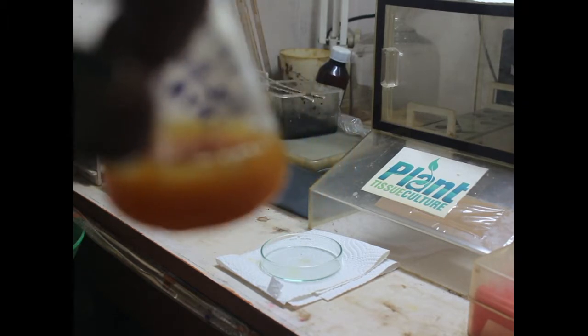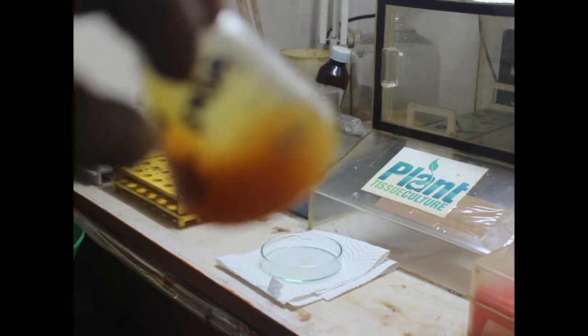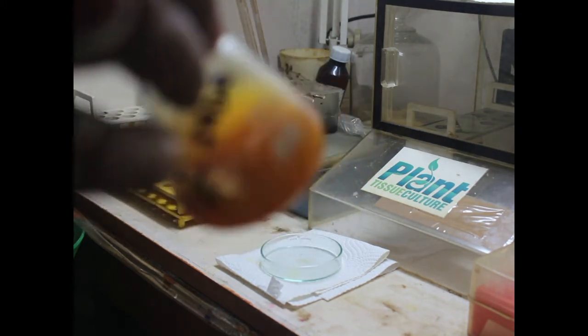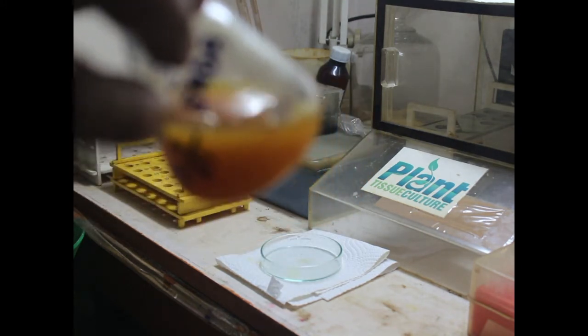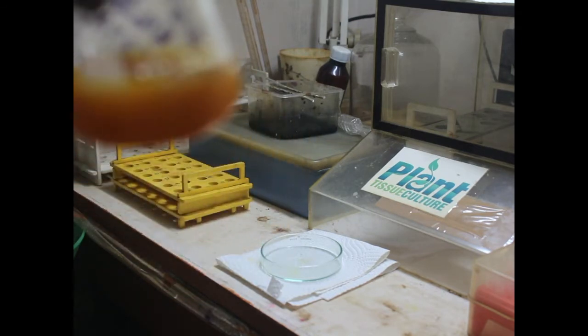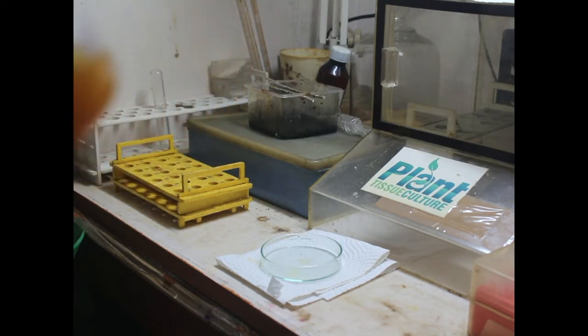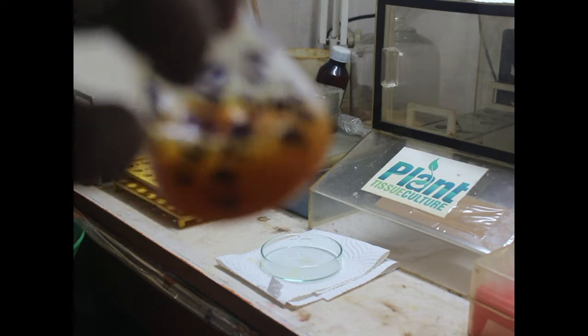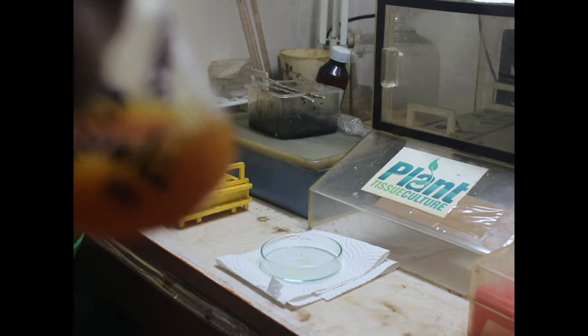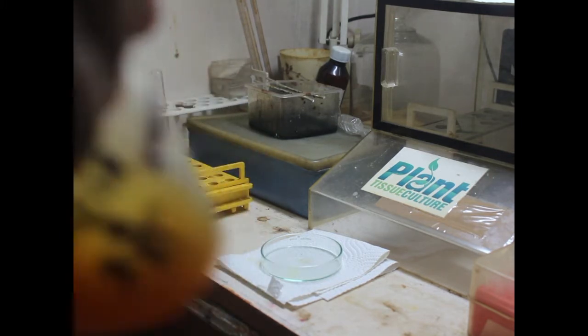This fungus has been started in culture from 3rd September 2021, and today in the morning a formation of mold was found. From this mold formation, the media has been morselated or homogenized. After this homogenized mixture, a beautiful mixture has formed and we will be going to see it under TCM 400 tissue culture microscope. We will be seeing the morphological structure today after about six days of culture.